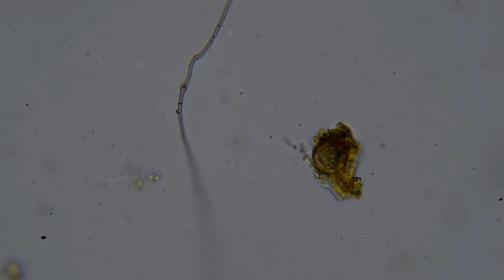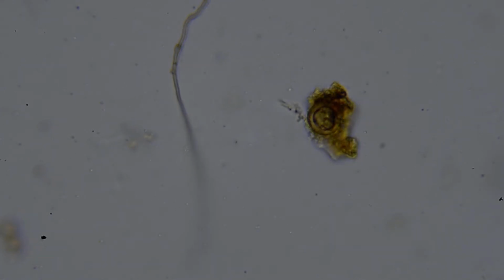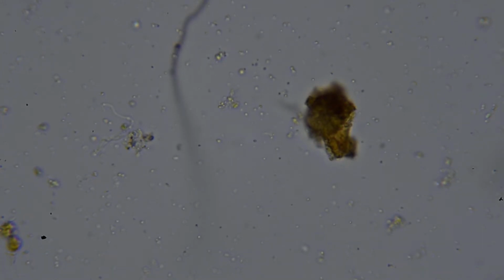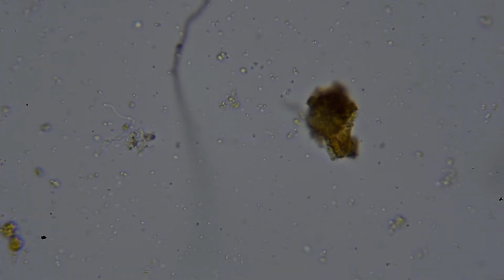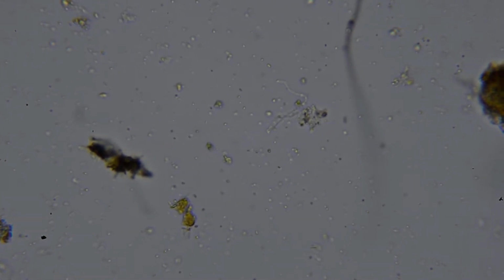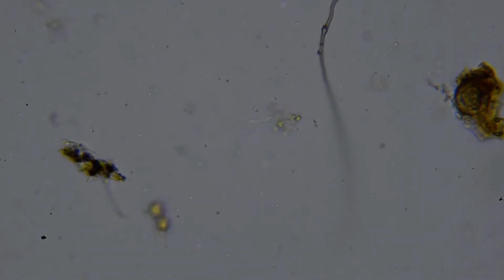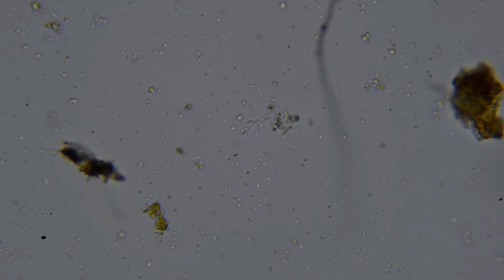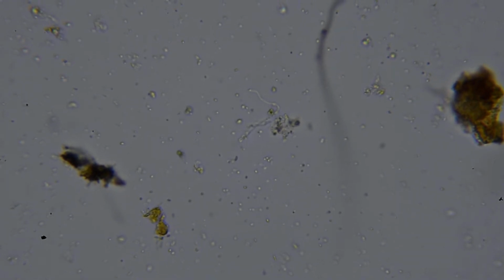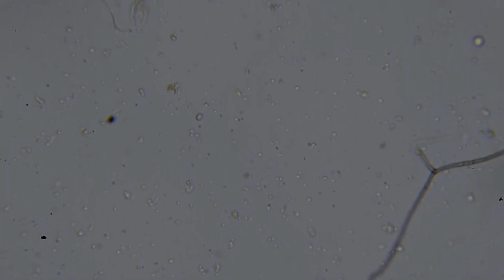Once it's grown the full length of a cell, it'll lay down this sort of recalcitrant septa. We can also see little clamp connections, and that's where it passes its DNA from one cell to the next, because the septa is actually blocking the movement of nutrients and DNA. So it passes its cytoplasm through this little clamp connection, those little bauble things that you see on the side of it there. So all these things that are gyrating around, they're all bacteria.